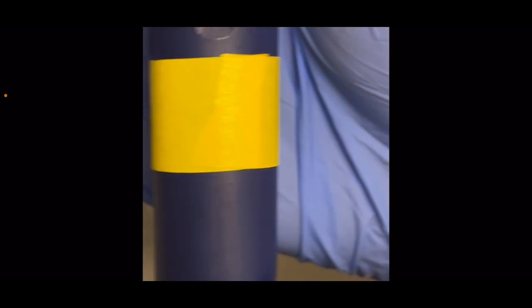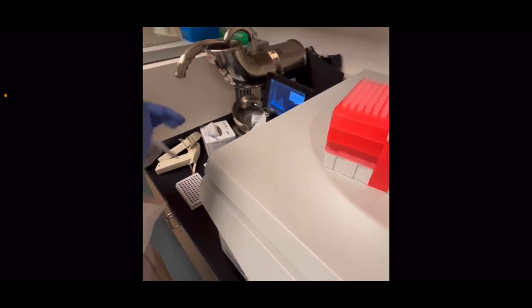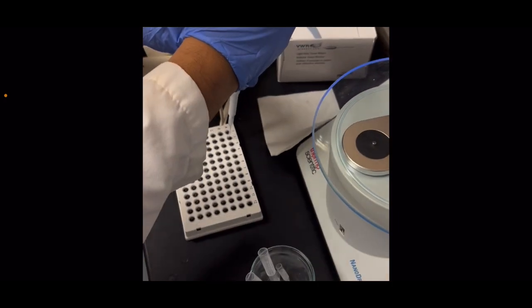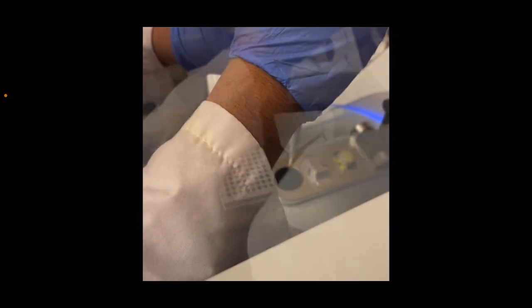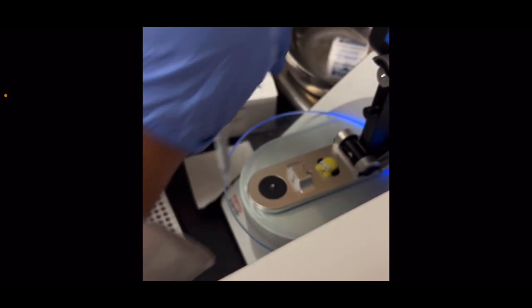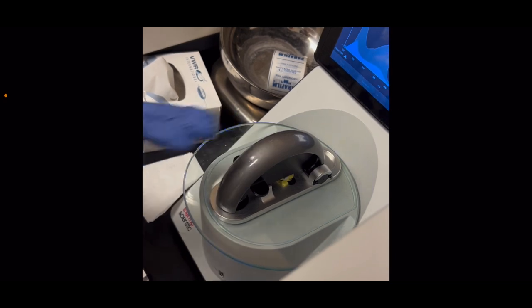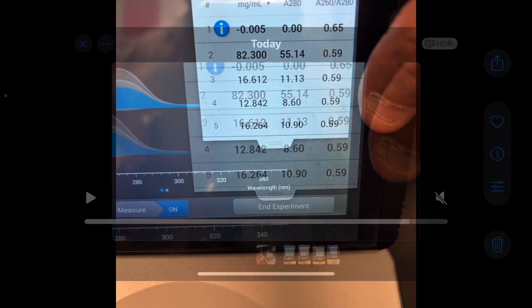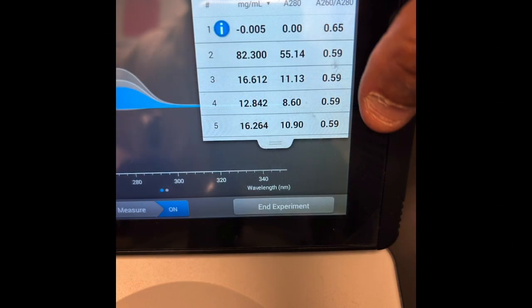Next, I'm going to add 3 microliters from each of these wells into the nanodrop, which is already zeroed with the DI water from before. I simply pipette it onto the small spot on the nanodrop, and then I measure each one individually. I cut it out because I'm sure you don't want to see me pipetting the same thing over and over and over. And now begins my data analysis.